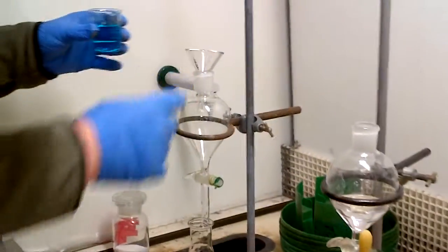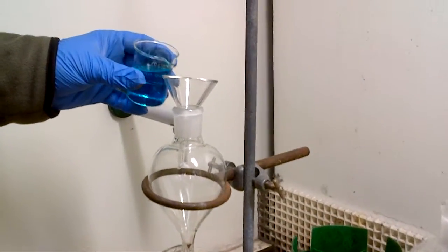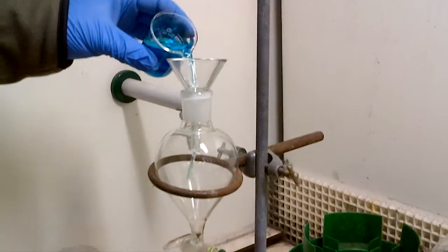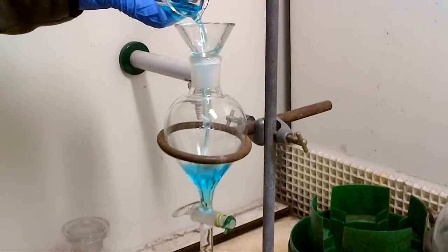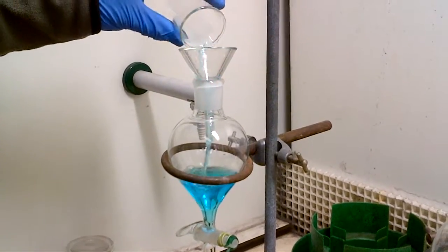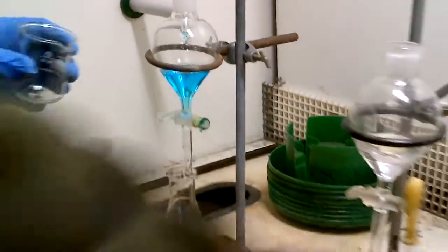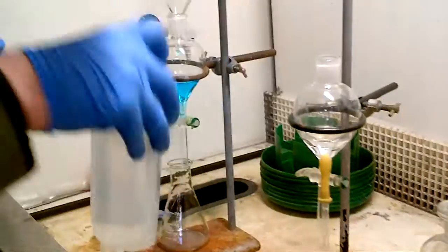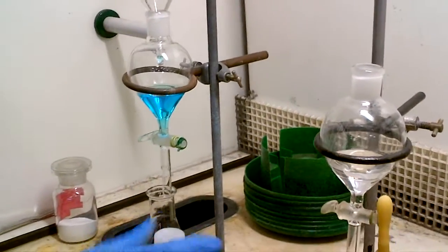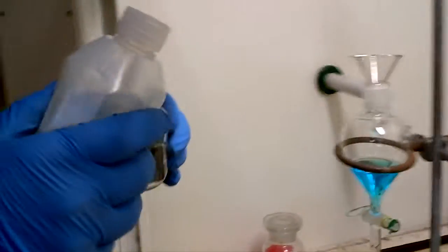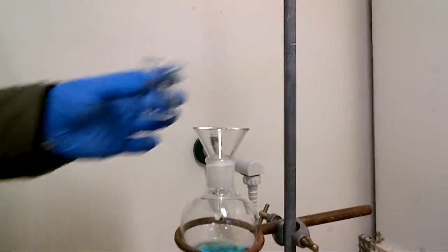So now, make sure you have a separate, sorry, filter funnel in place in the set funnel, pour in the solution, and if it's an aqueous workup, you might just want to make sure that you transfer the remaining solution in, just get a touch of water, maybe move it over.